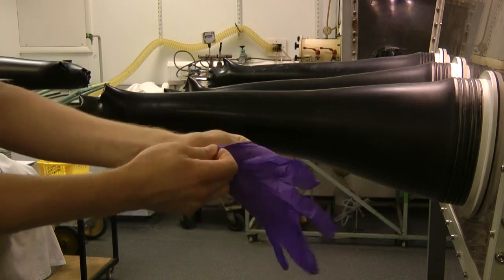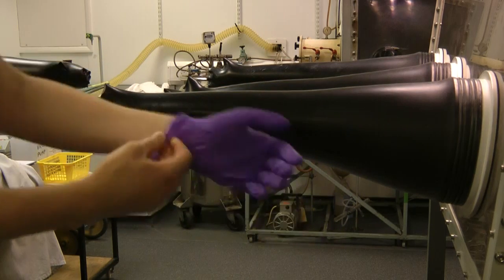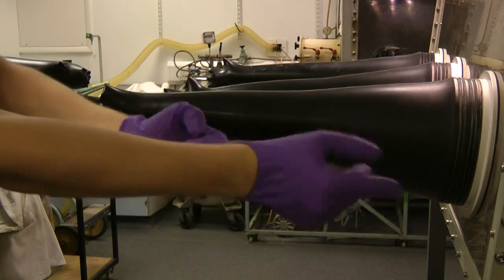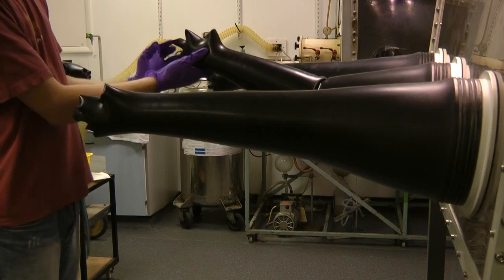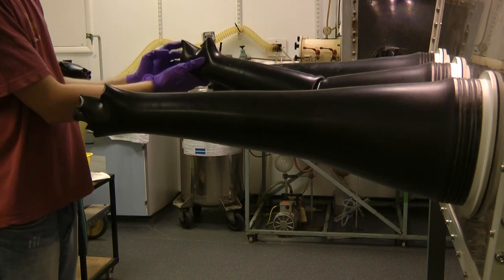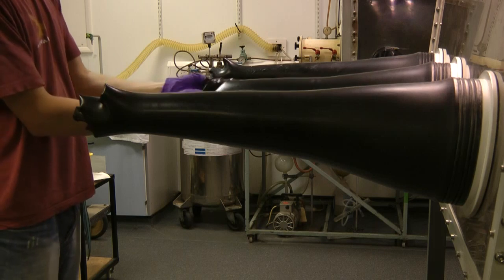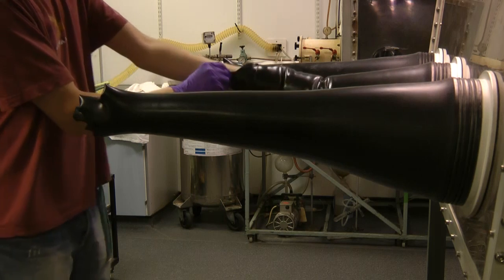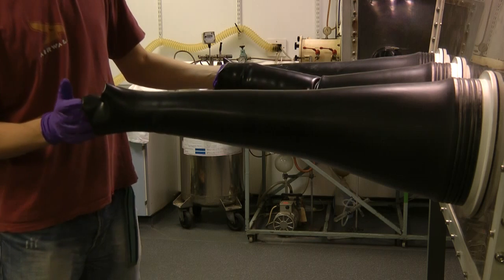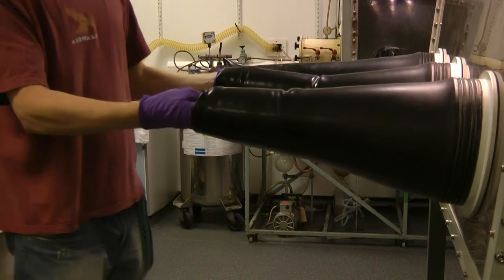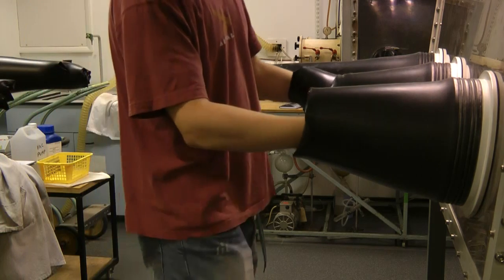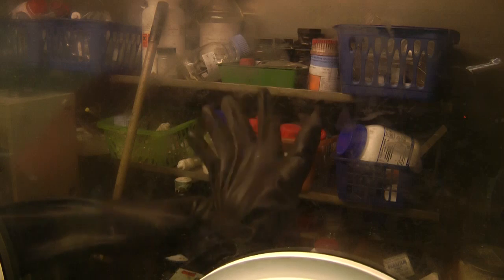Ensure you wear gloves, as it keeps it clean for the next user and also prevents any tearing from fingernails. First, insert your left hand guided with your right. It sometimes helps to wiggle your fingers slightly. Pull the glove down to your wrist, and then insert your right hand. This part can be quite tricky. Then push both hands forward into the glove box, not too fast. Once inside the glove box, rearrange it so the gloves are comfortable and you have full dexterity.